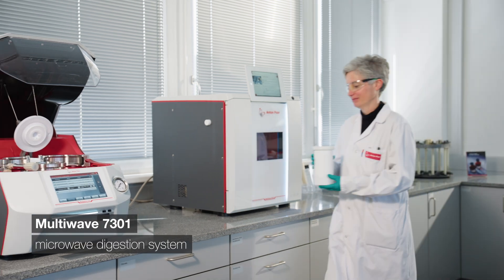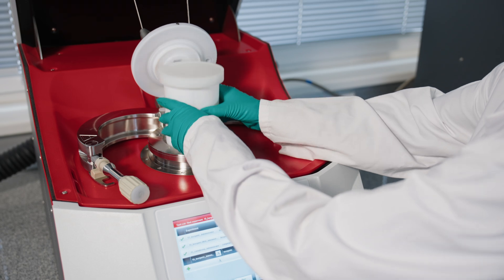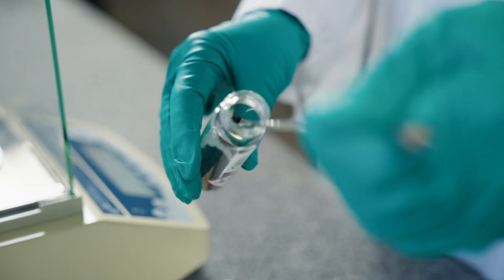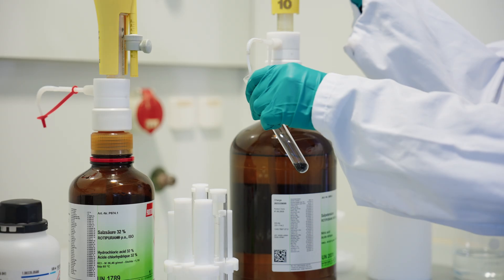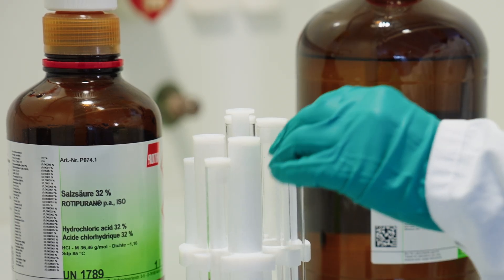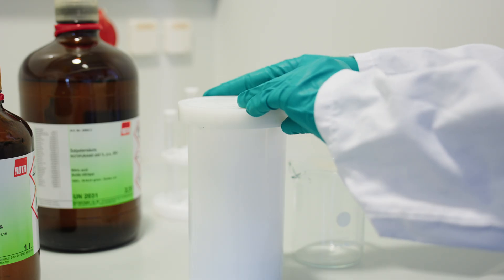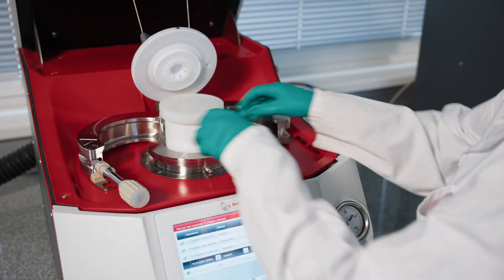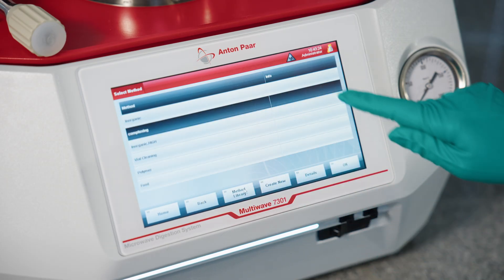The choice of microwave device depends on the type of analysis — for example, R&D versus QC work — and the number of samples. The procedure is as follows: weigh in the sample in the digestion vial, add the acid or acid mixture, close the vials and insert them in the microwave rack, place the loaded rack in the liner, cover the liner with the drip cup, and transfer it to the instrument. Then select the temperature program that is usually saved in the instrument method database.